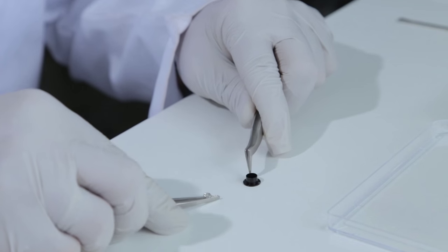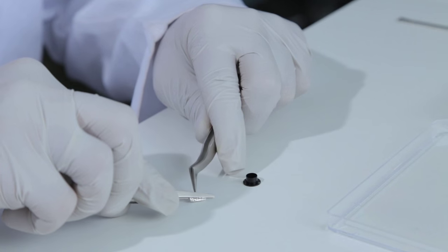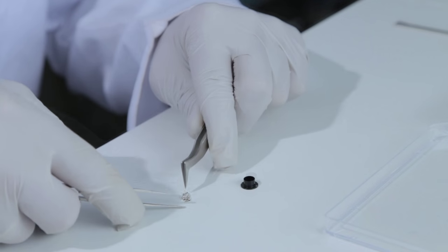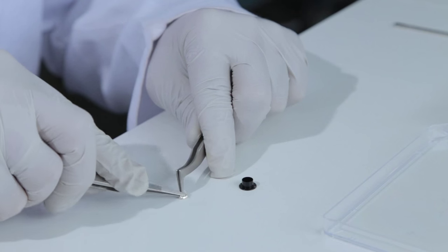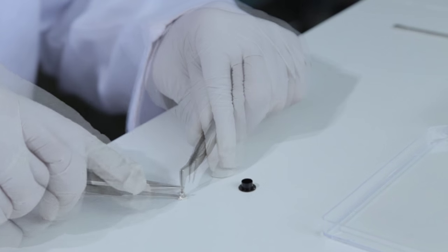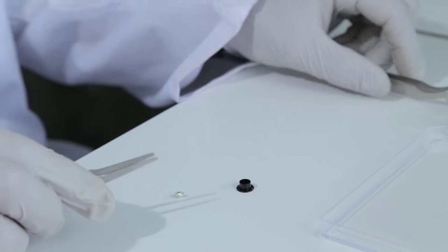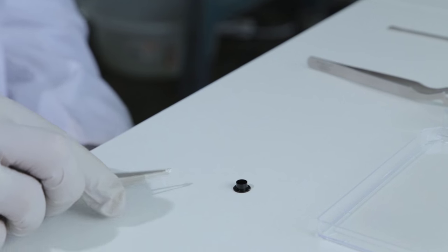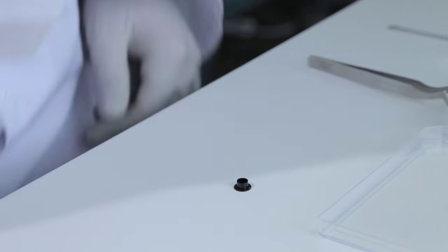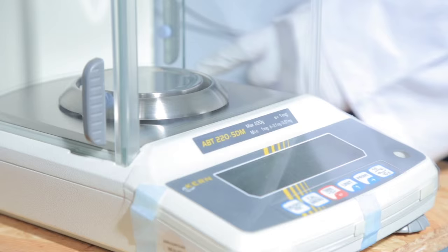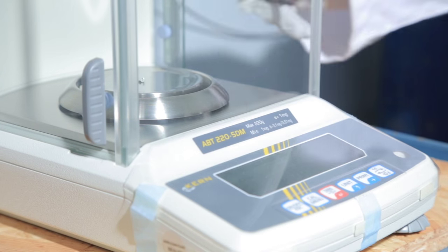Prepare the vial according to the instructions and return the crimped vial to the balance and re-weigh it. Weigh each standard three times to obtain results reproducible to within 1 to 2 micrograms.